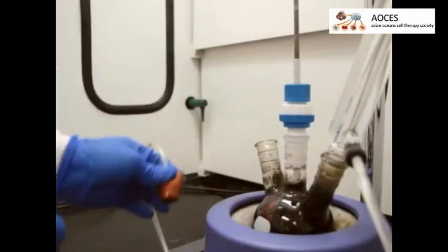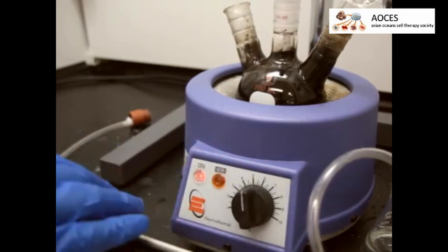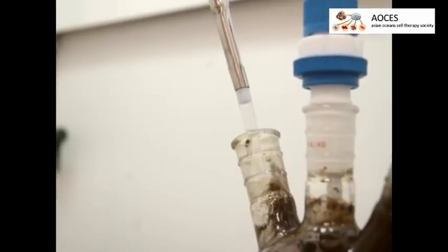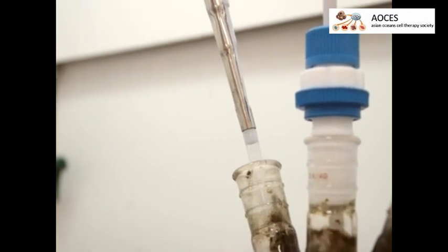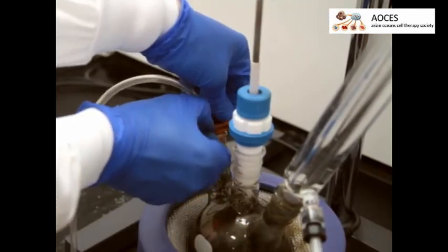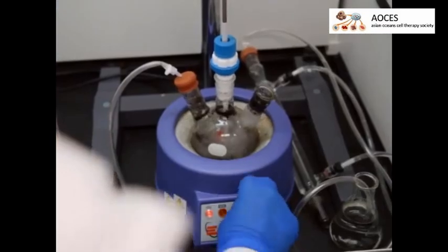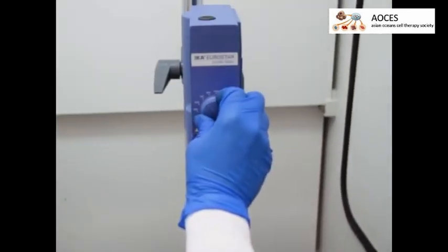Remove the rubber septum and gas line and heat the reaction to 90 degrees Celsius. Then add 1 milliliter of oleic acid to the flask to coat the nanoparticles and form the magnetite gel. Next, replace the septum and the gas line on the flask and remove the condenser. Turn off the heat and stir the reaction at 500 RPM for 2 hours.